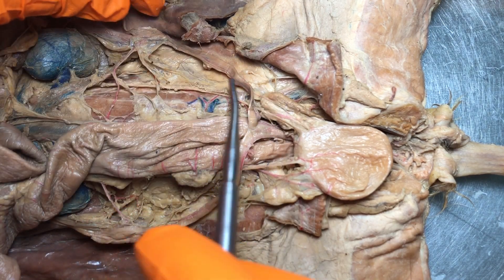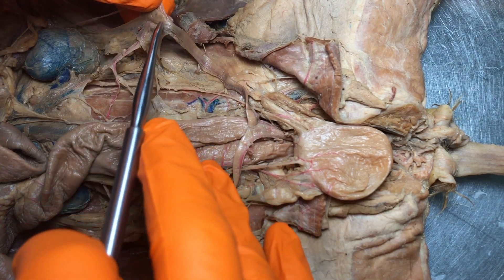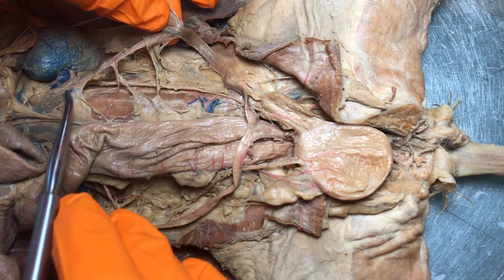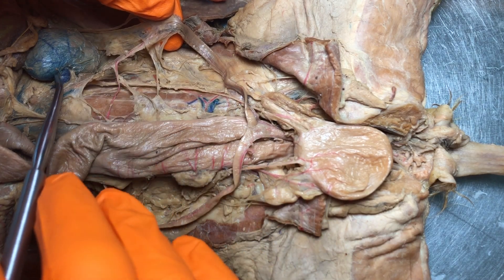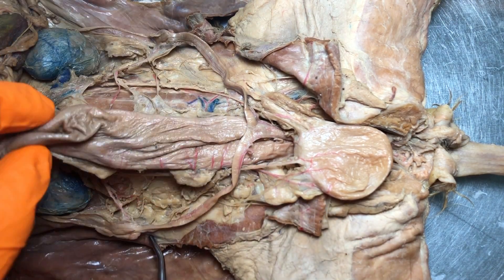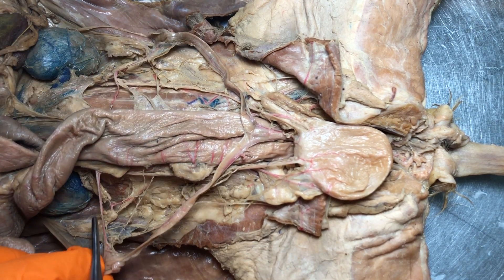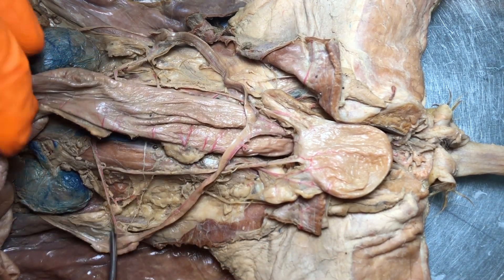We also have the ovarian arteries and veins. This right here would be the left ovarian artery. We only see part of the vein up here, and remember the vein on the left side connects to that renal vein — so that's a little memory trick for you. On the right side we can see the ovarian artery that connects to the abdominal aorta.